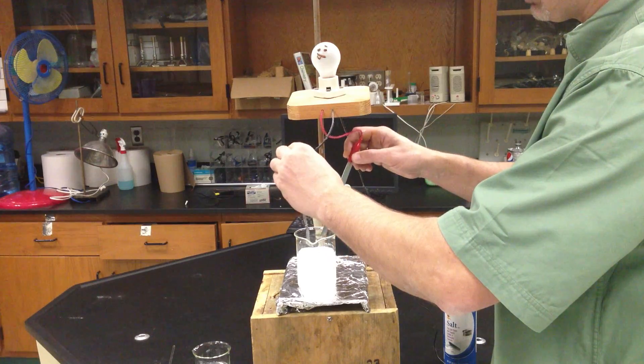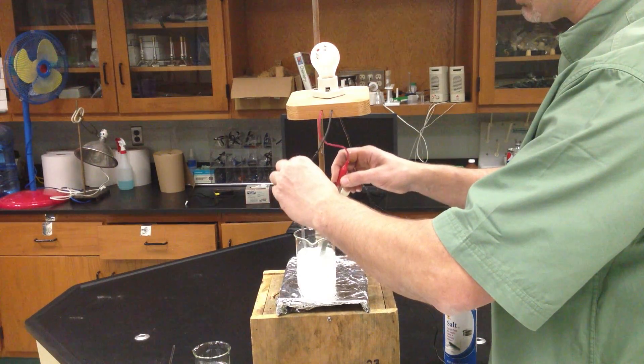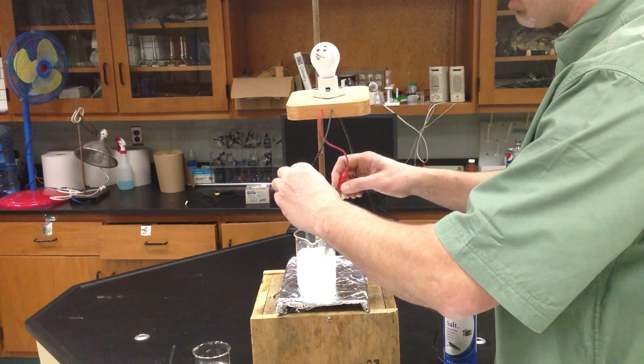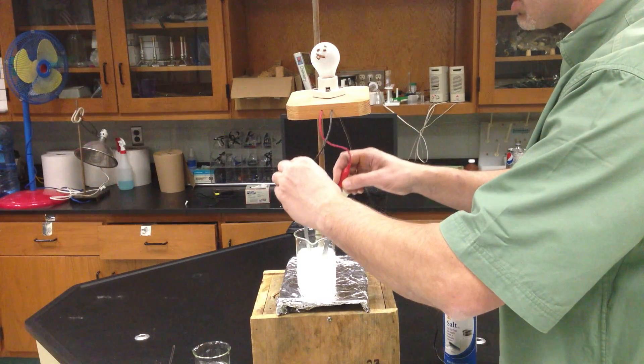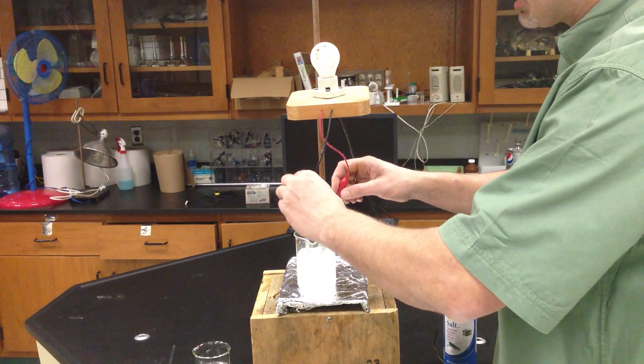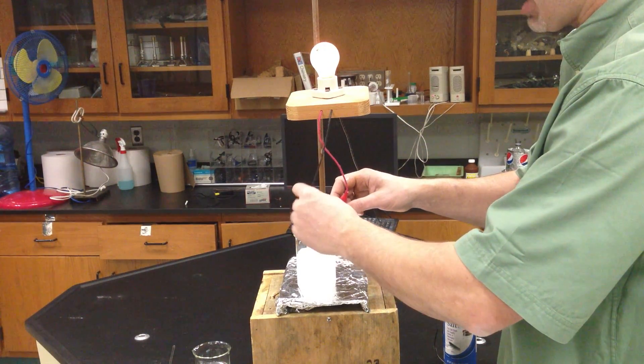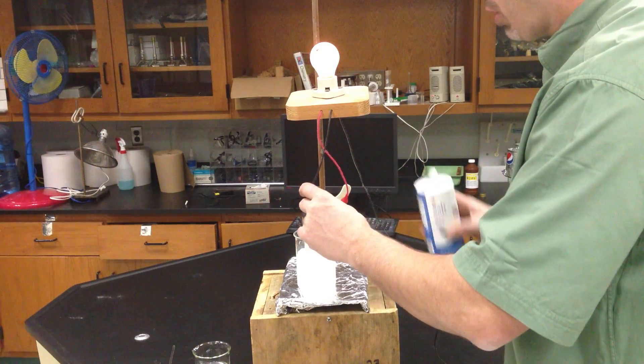Not great, but it definitely goes on, and that's because of the ions that are able to move. The negative ions go to one side, the positive to the other, and charge is conducted. Now, it's not a great deal, but if I add more ions, the charge should increase.